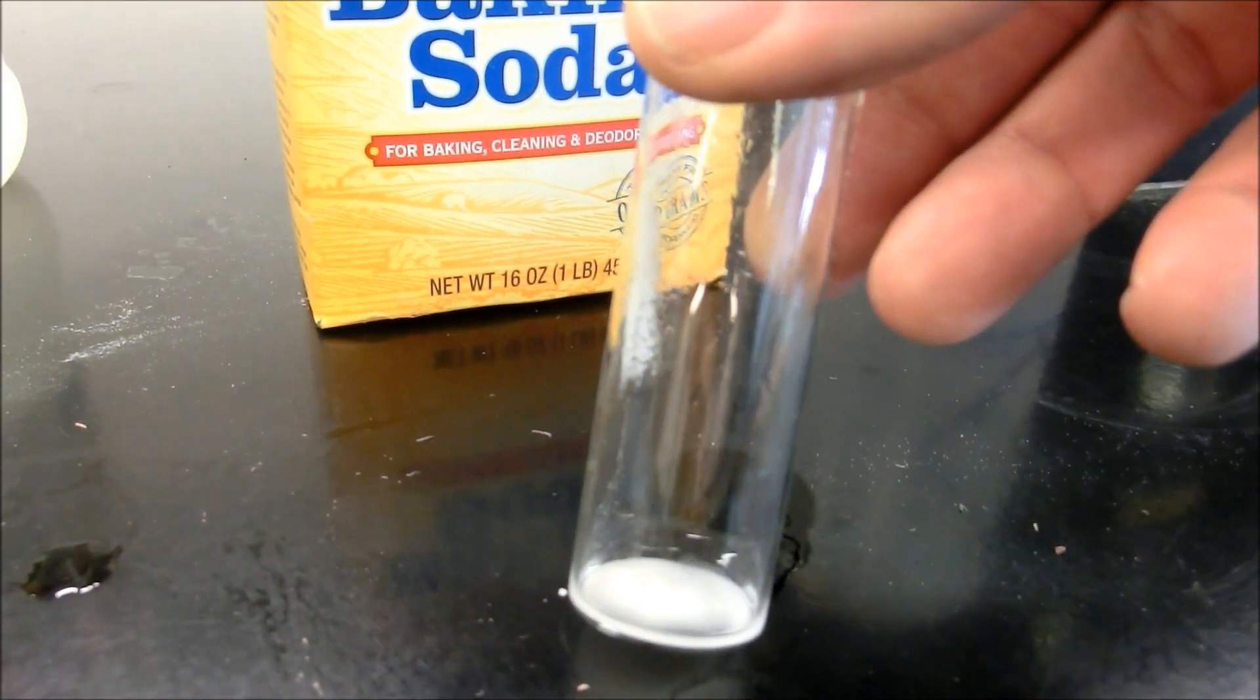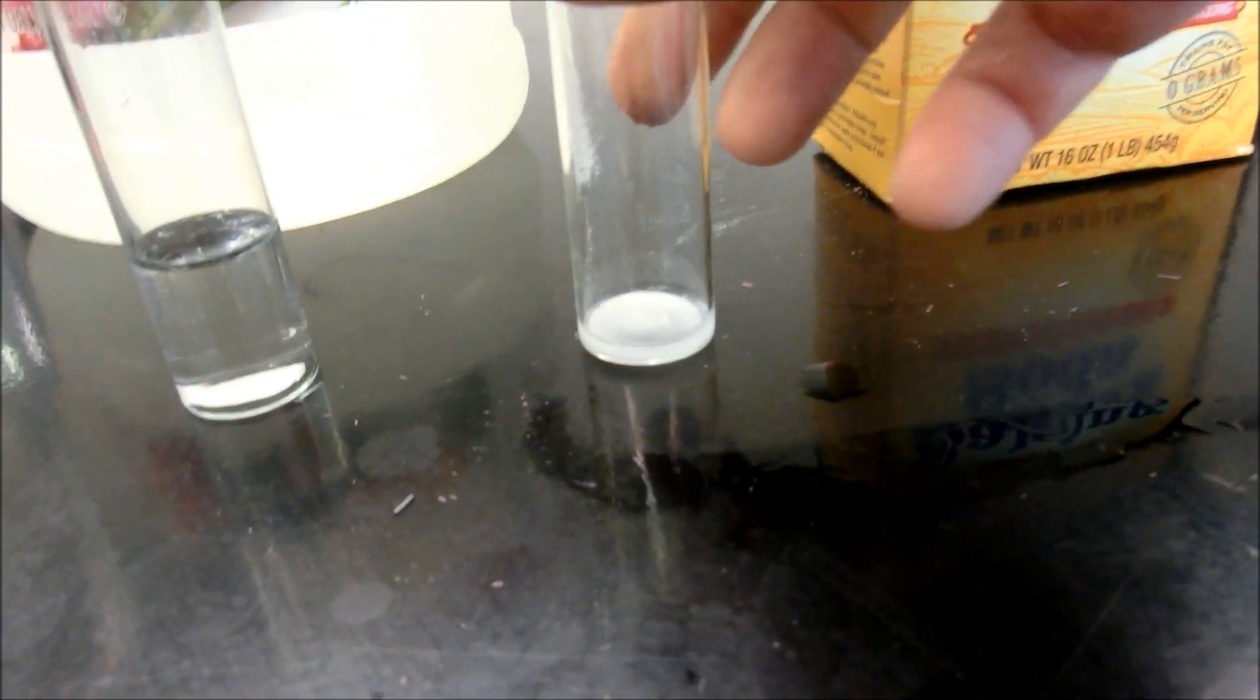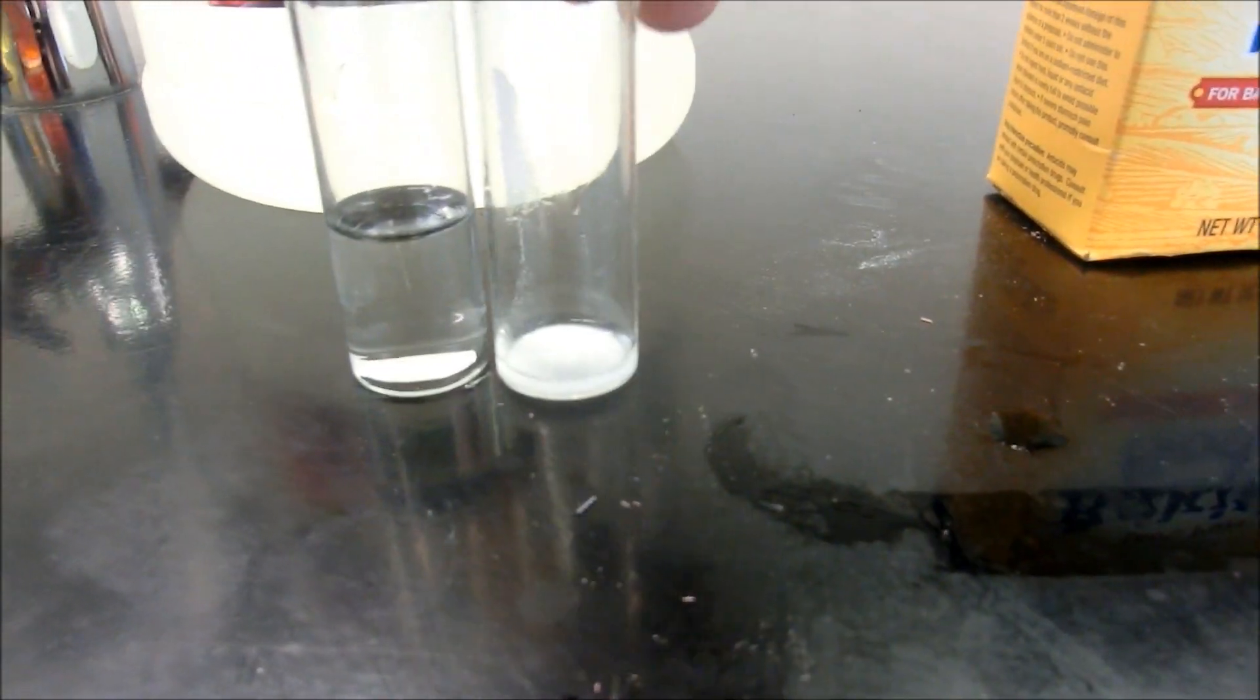There's a little bit of water in the bottom of that tube, so that's why it's a little bit wet. Let me even dry that bottom portion off. There we go. So let's go ahead and mass those two together.